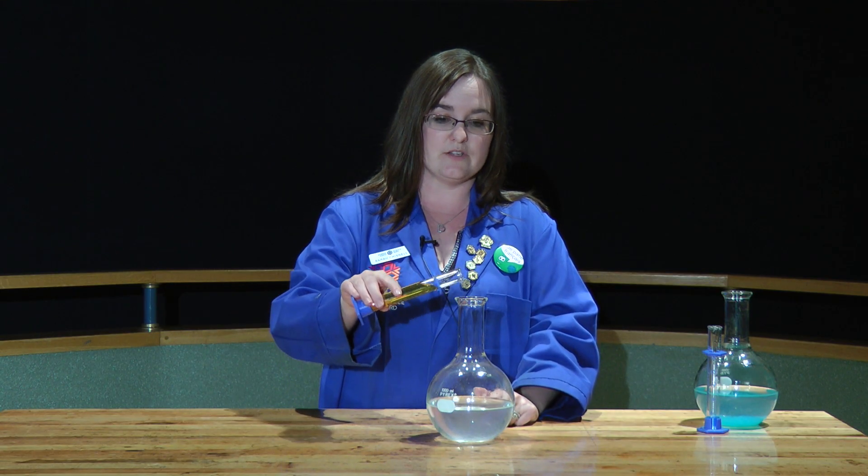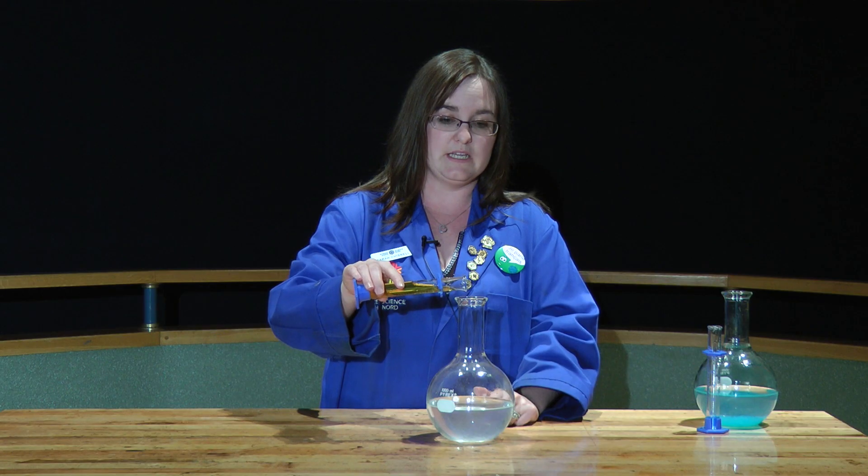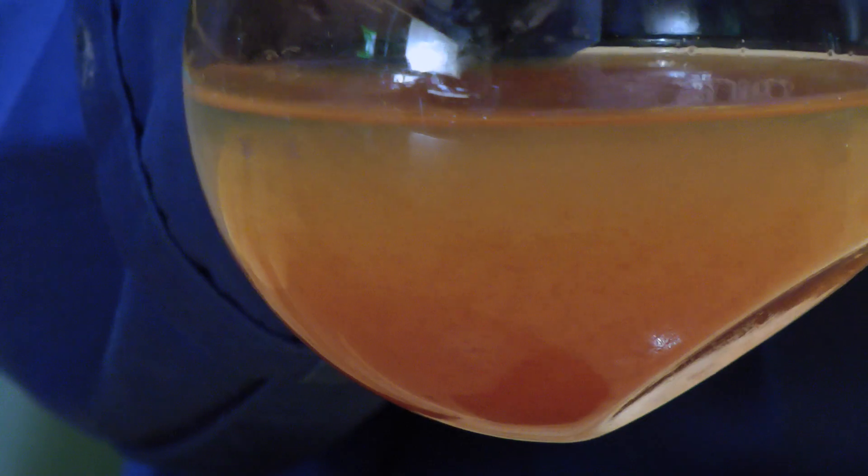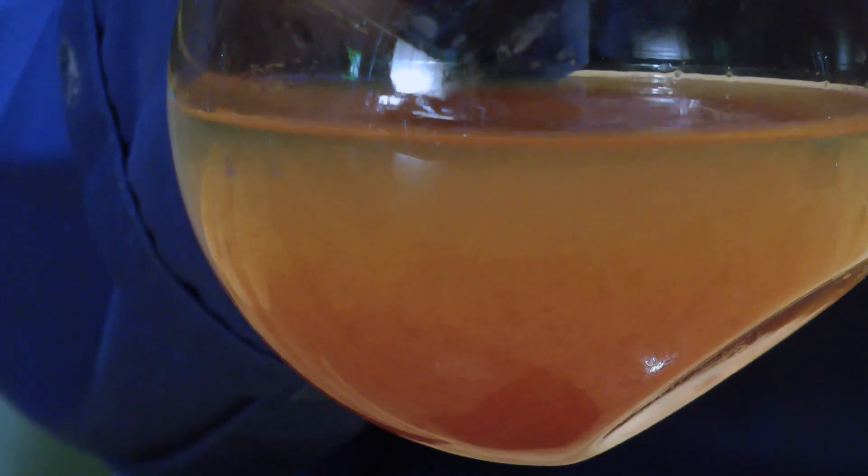Now, iron has this kind of orangey tinge to it. So when we pour this in, you can see that it's still the iron that's making the solid product in there. So again, we use this to isolate products that we want, and they're very useful in chemistry.